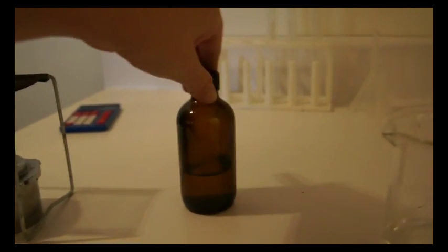Now this concentration, anything above 35%, will decompose very, very quickly. I stopped that by putting it in a jar just like this so sunlight can't get through. Here there's actually a 51.4% concentration and it actually took me a while to make this - this is my first, second attempt at making it.